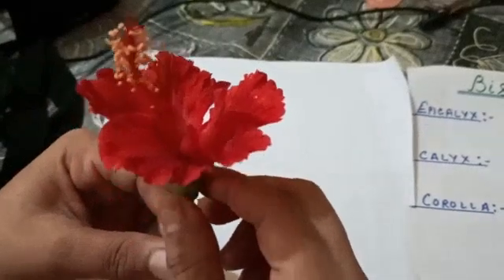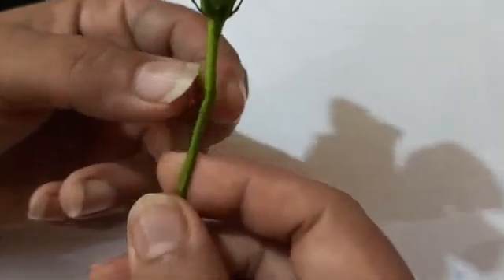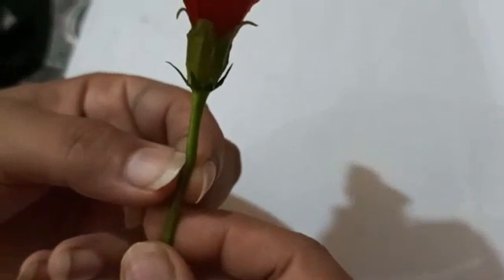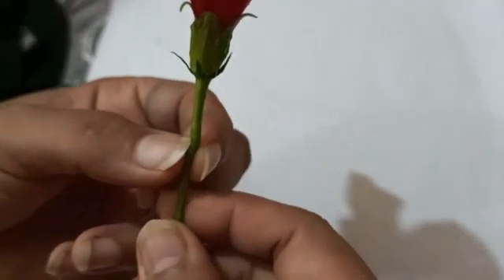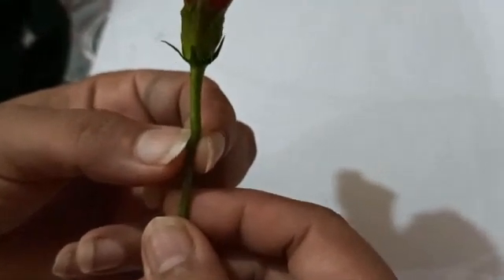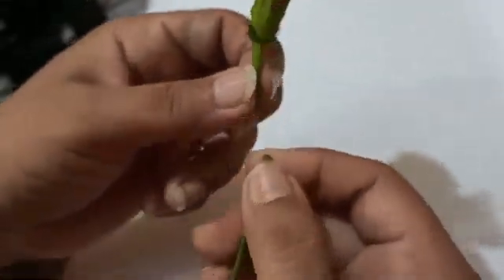From here you can see a mark indicating that from this point to this part is the stalk of the flower. For this we use the term pedicel. If the flower stalk is present, the flower is termed pedicellate. Now I'm going to pluck it from here — this is the stem, this is the stalk of the flower.